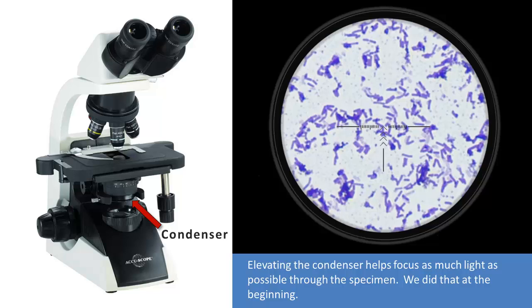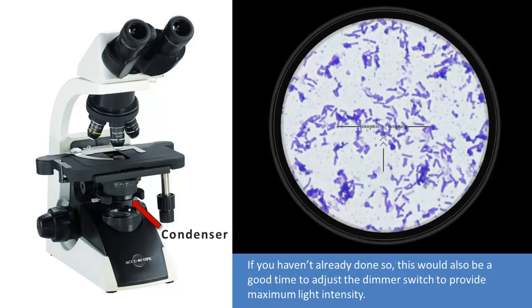Elevating the condenser helps focus as much light as possible through the specimen. We did that at the beginning. If you haven't already done so, this would also be a good time to adjust the dimmer switch to provide maximum light intensity.